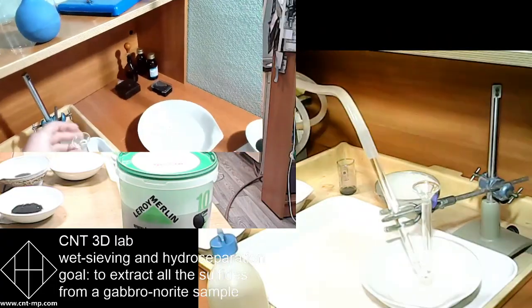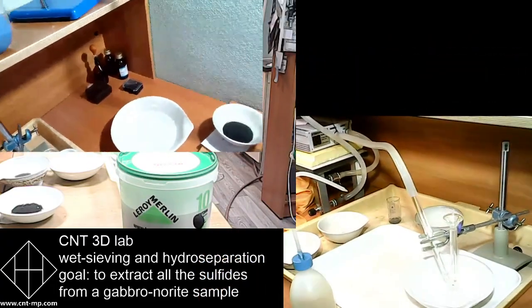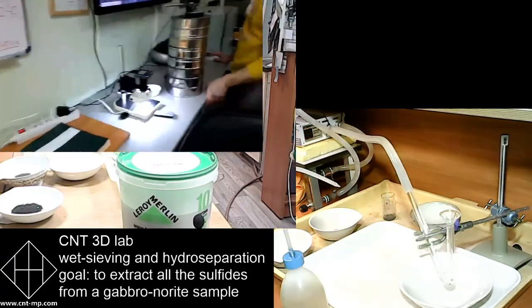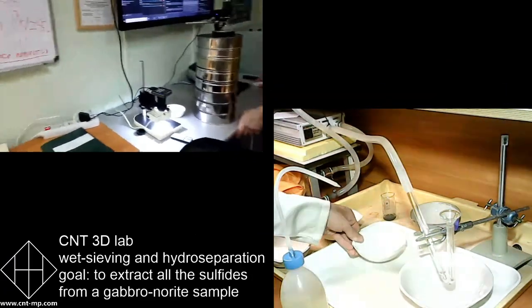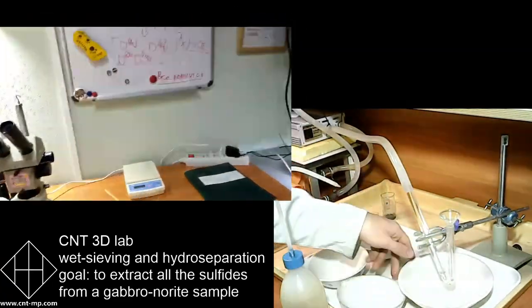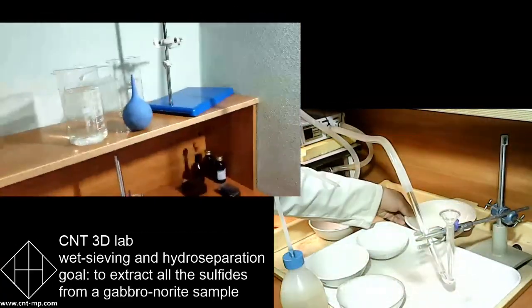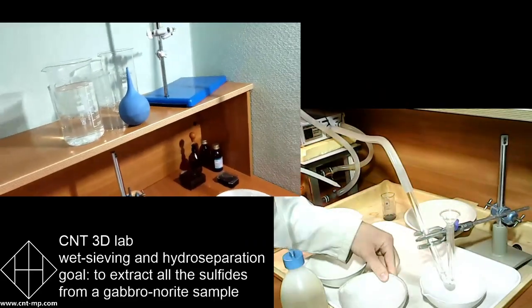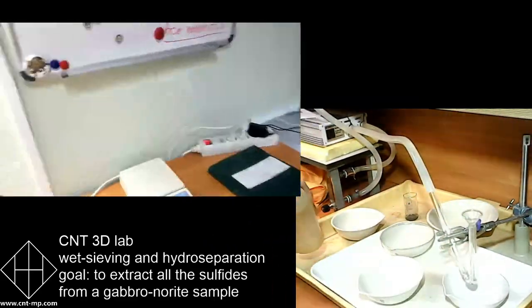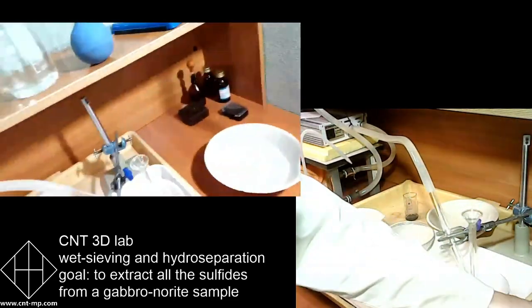So now the hydroseparation starts. On the amount of sample, we go from the coarser one, but this time we will show you hydroseparation on whatever grain size is ready for processing. Would you mind, guys, to explain what is the size fraction and everything, so people will understand what you are working with now?